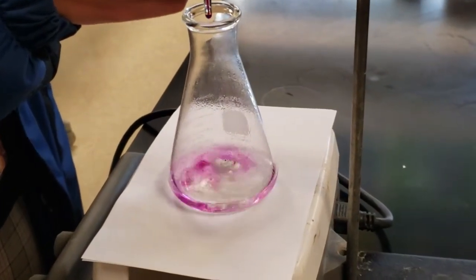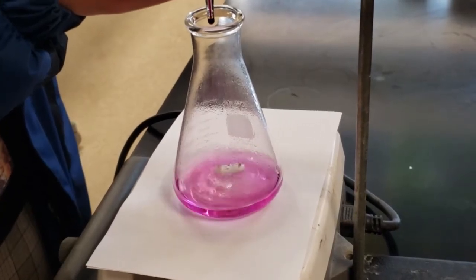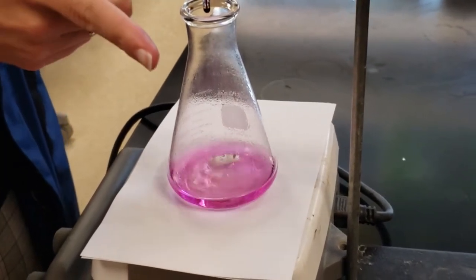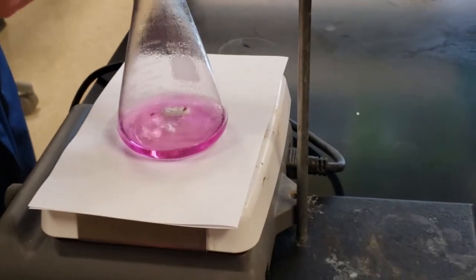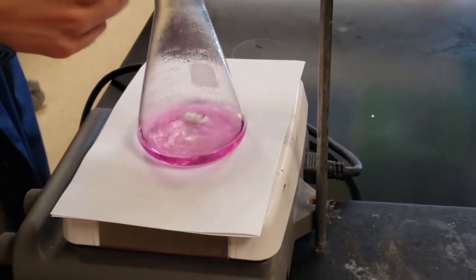As you can see, the color is persisting longer and longer. At this point, it stops changing, which means we have used up all the peroxide. We are probably only one or two drops off of this equivalence point.